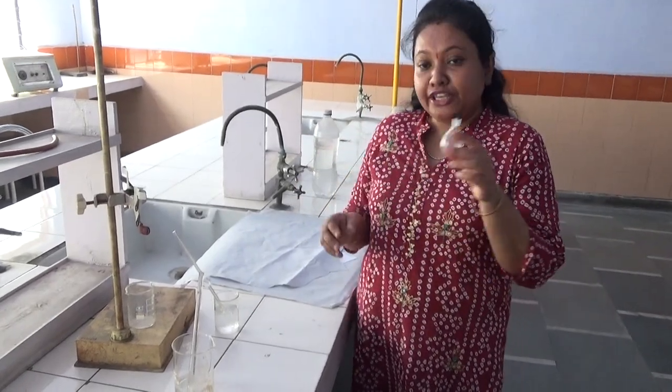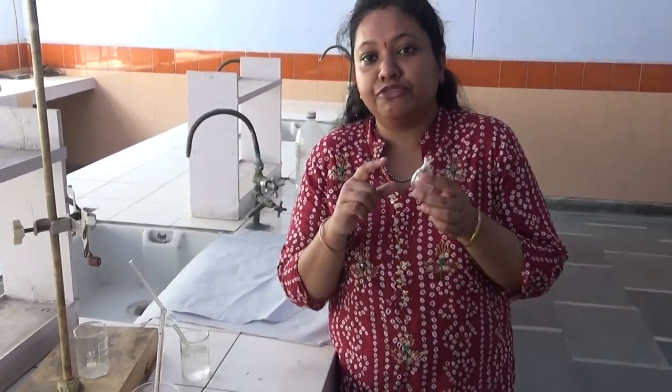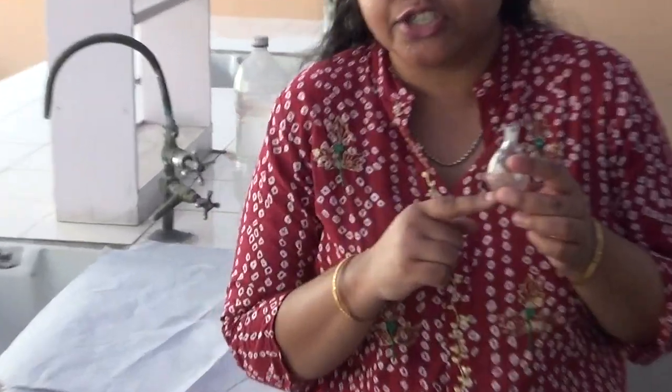First, you have to find out the density of your surfactant. So, density — this is your RD bottle. By using this RD bottle, you will be finding out the density of the surfactant.